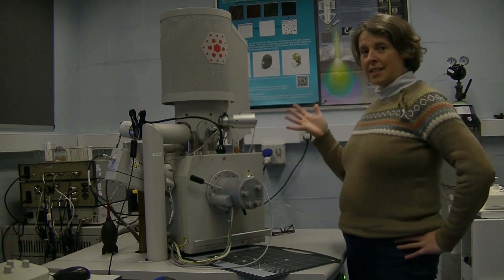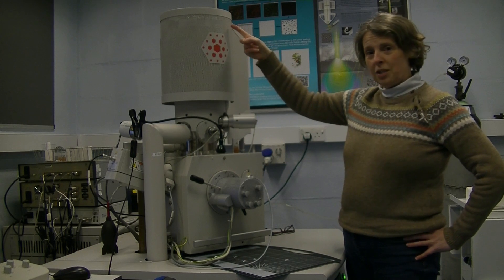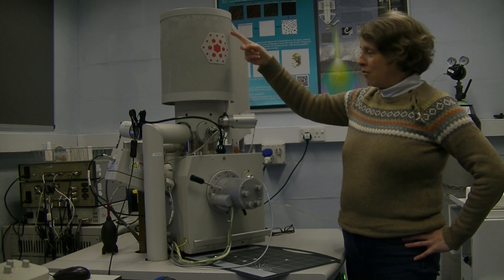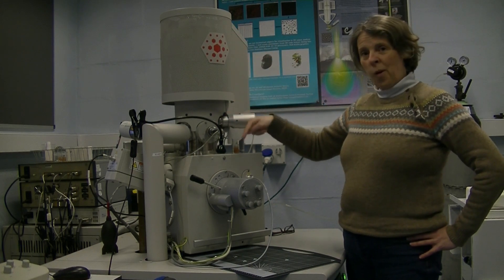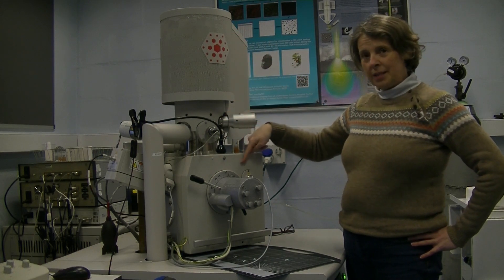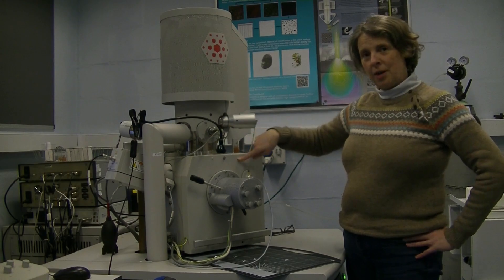This is a scanning electron microscope. A beam of electrons is produced here and travels down through the column where it can interact with the samples which are inside the chamber here.